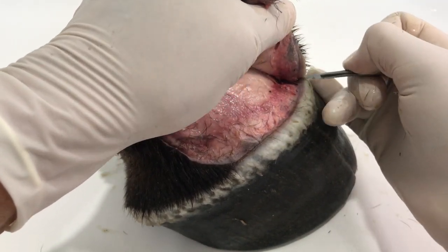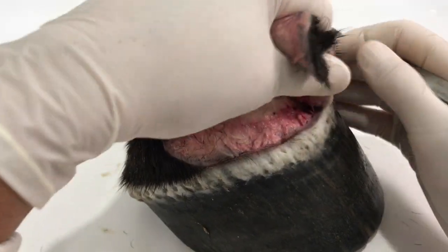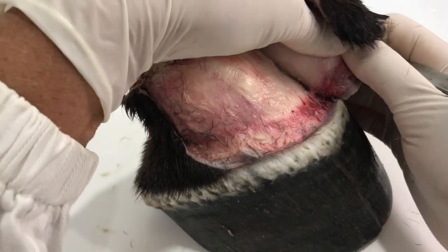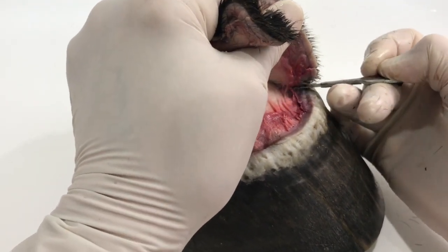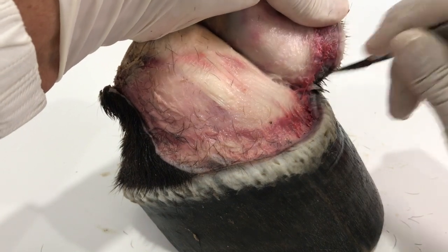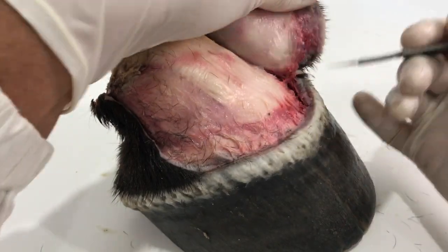Think of how we lay fat down in our hips and bottoms to protect our joints when we fall - horses don't have that equivalent protection at the front of the hoof. It looks like I'm actually cutting through some of the coronary area here. I'm not too worried about damaging these structures because I just want to get the hide off and see what's going on underneath. This isn't a proper dissection as such - it just has a purpose: to get to the capsule, get the capsule off, and get the bones out.